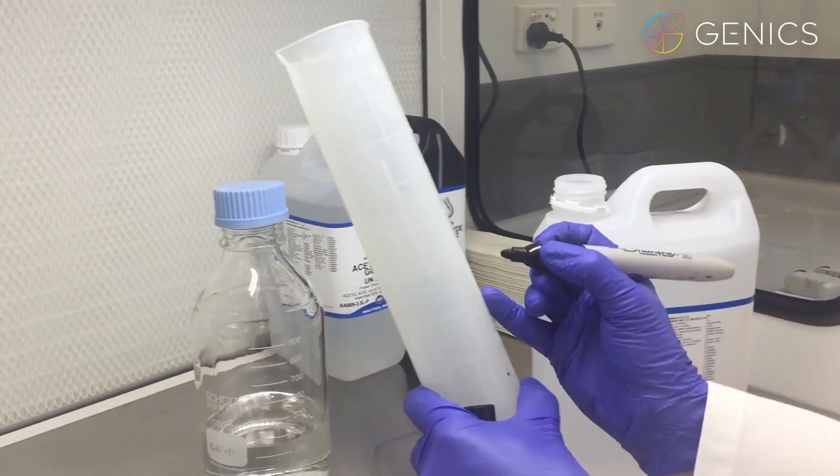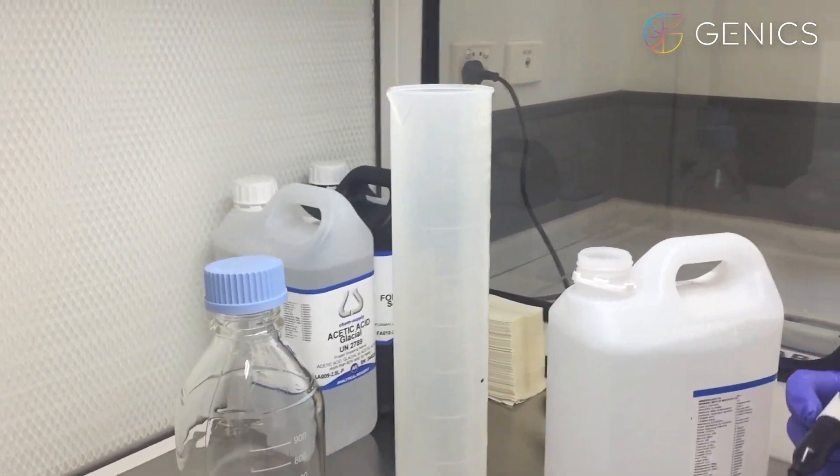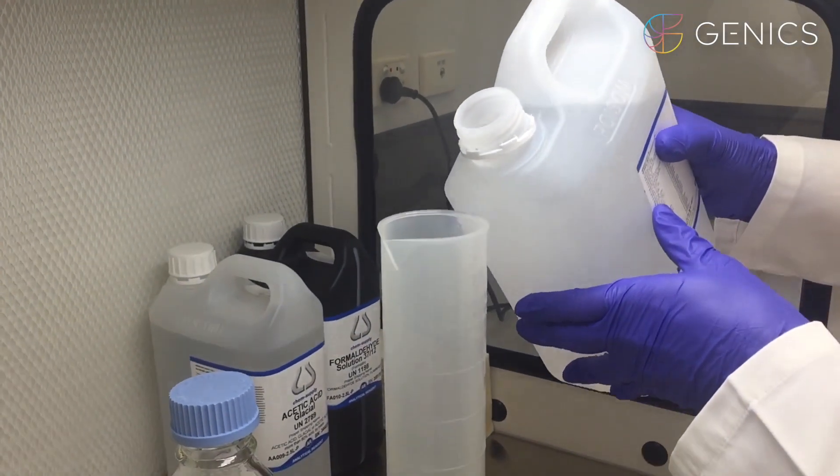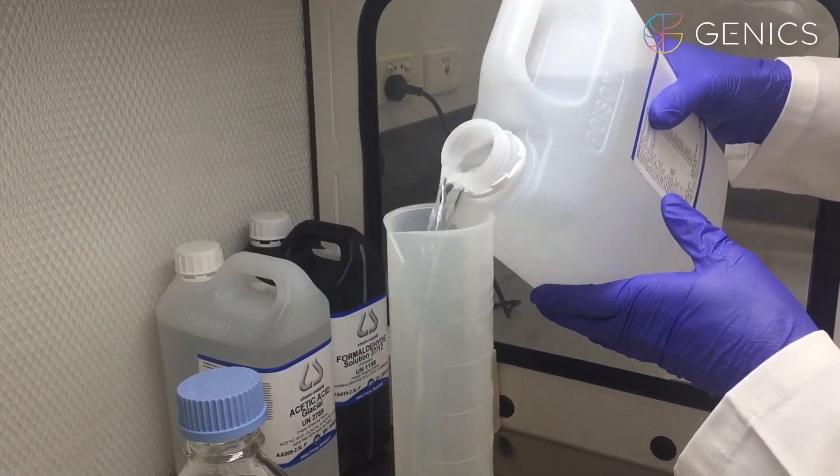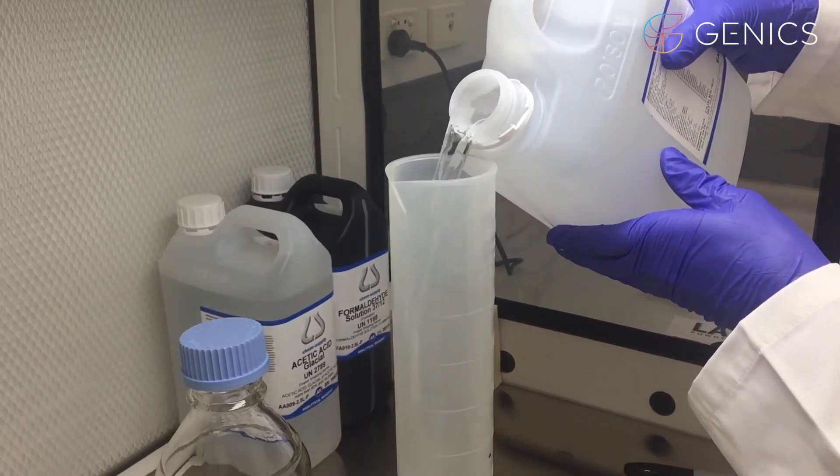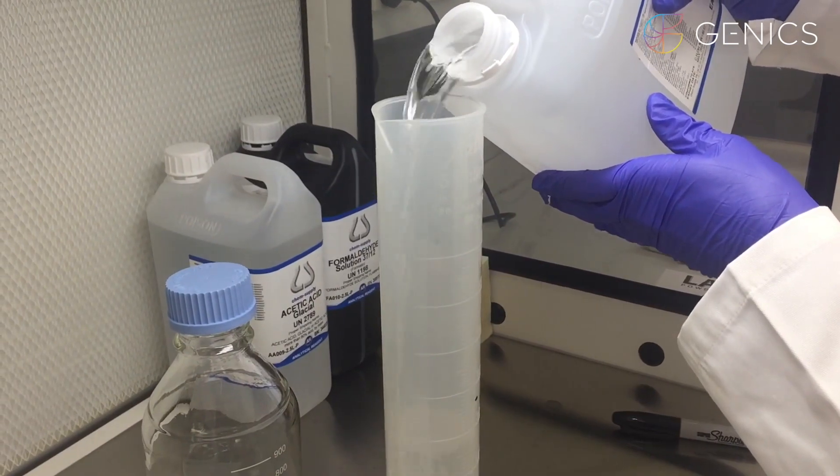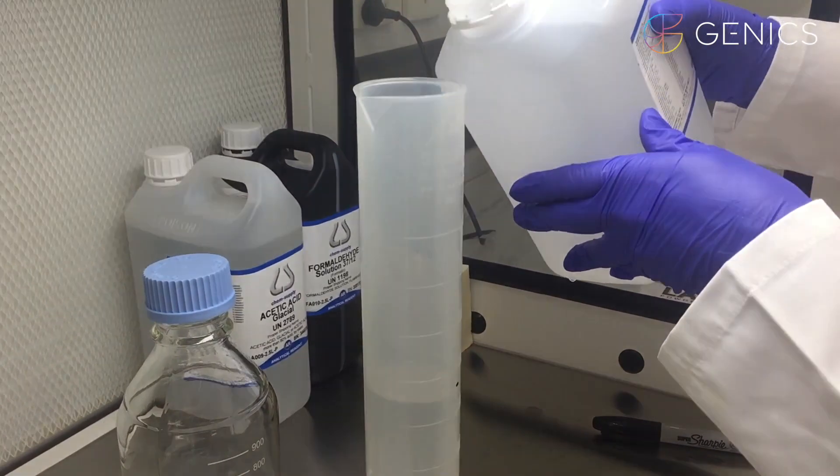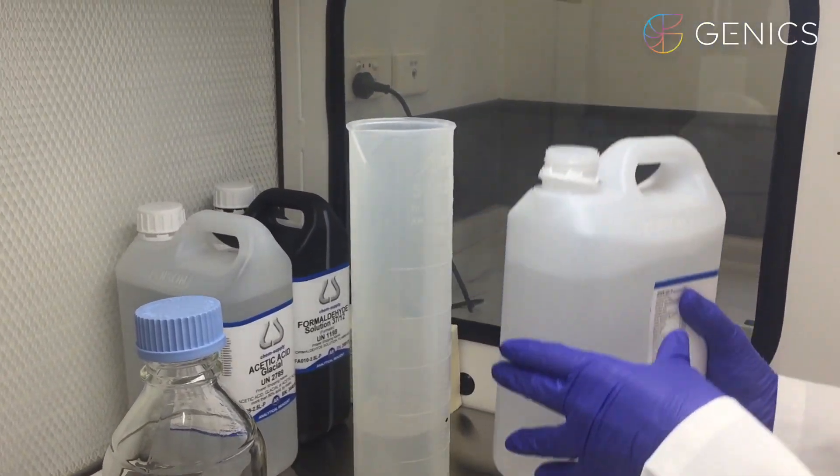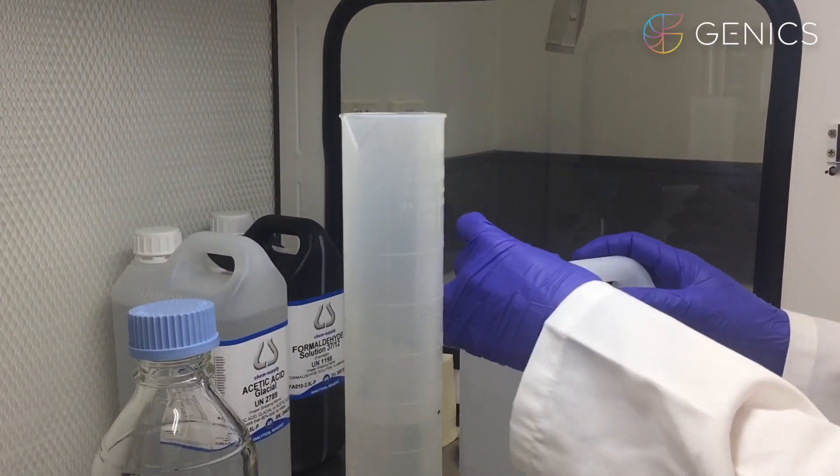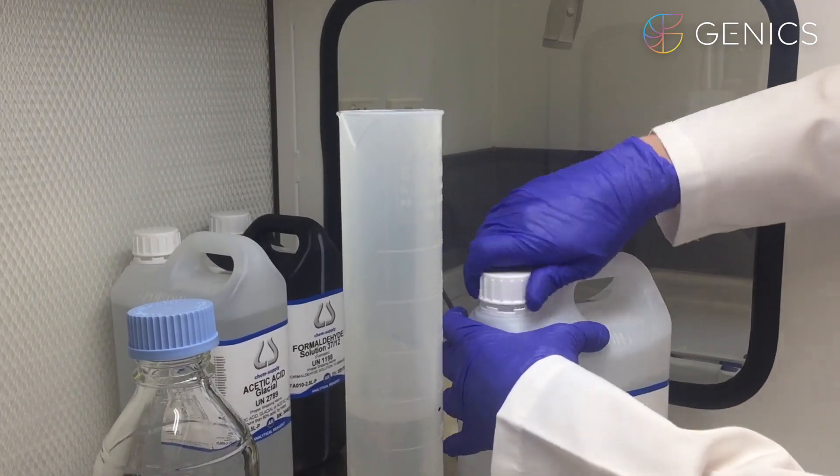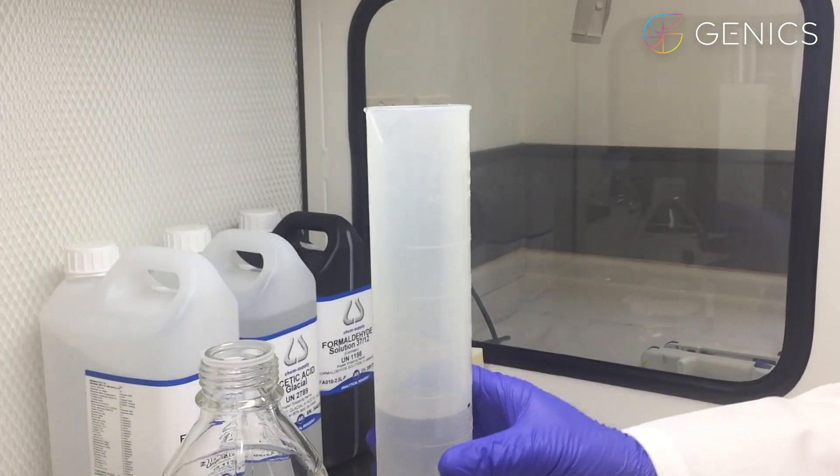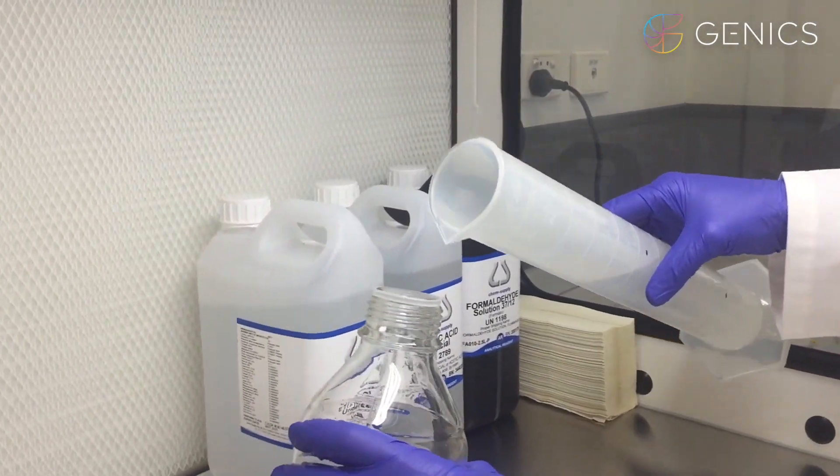We'll mark here again. I'm going to pour that into our Scott bottle.